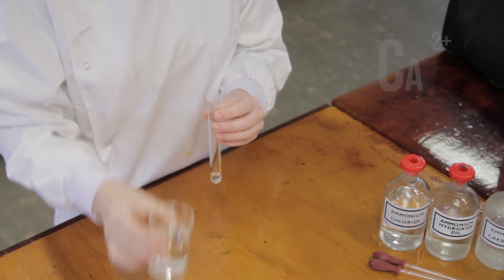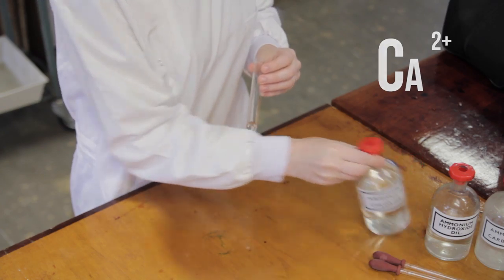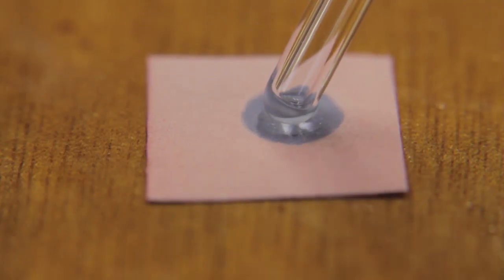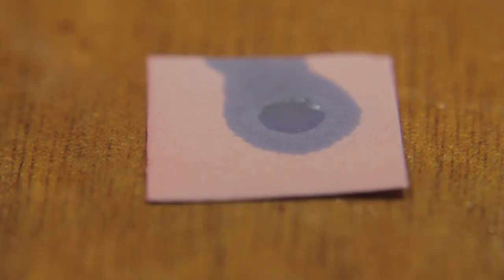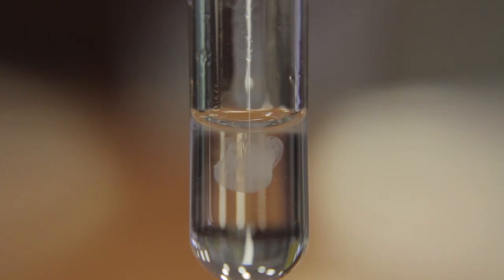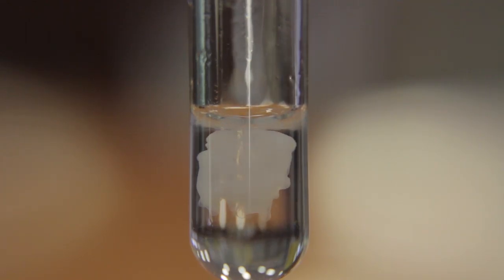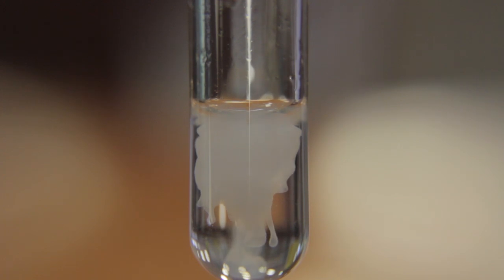The calcium ion Ca2+ is an insoluble carbonate. By adding ammonium chloride and ammonium hydroxide the solution becomes basic. When we add ammonium carbonate a white precipitate is formed. This is characteristic of insoluble carbonates.